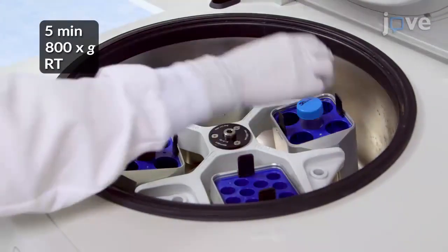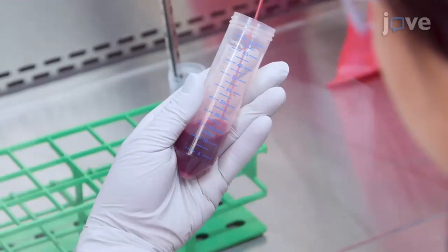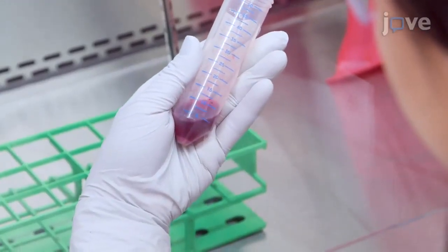Remove the cell debris by centrifugation and aspirate all but the last 2 to 5 milliliters of the supernatant.